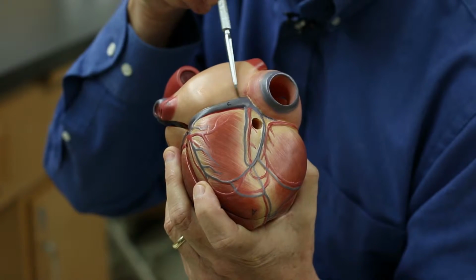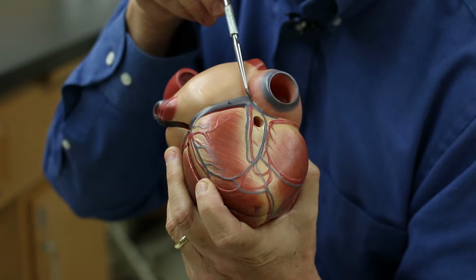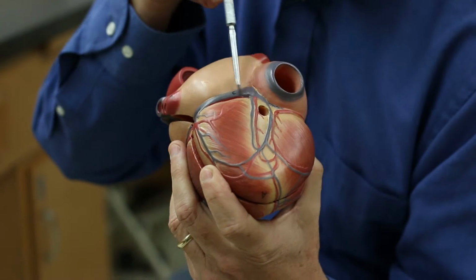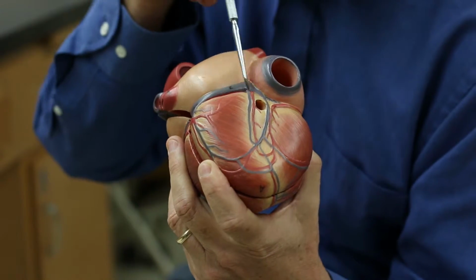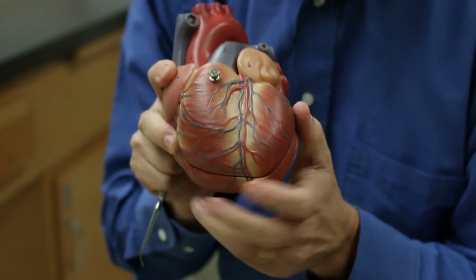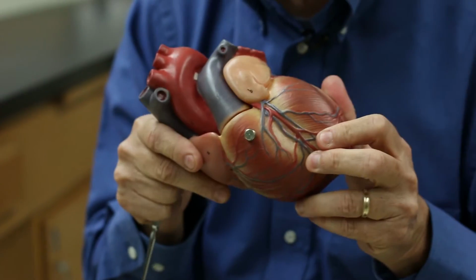This section is called the coronary sinus, and a sinus is just a special type of vein. And here we have it running here in the back. Should be able to find that on the sheep hearts. When you do get your heart, you're probably going to want to poke around, orient it.